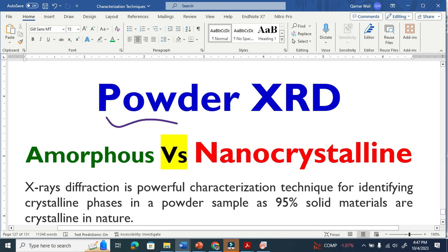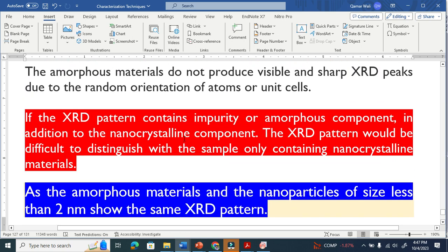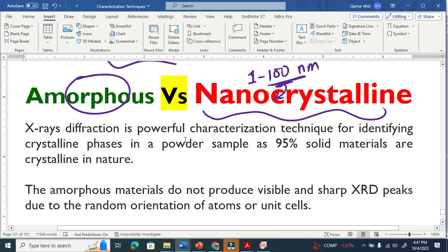Let us compare the powder XRD analysis of amorphous material with nanocrystalline material. We know that if any dimension of a material is in the range of 1 to 100 nanometers, we call it a nanocrystalline material, right? This is a very interesting topic because we know that the amorphous material gives a broad peak. Similarly, the nanomaterial also gives a broad peak.